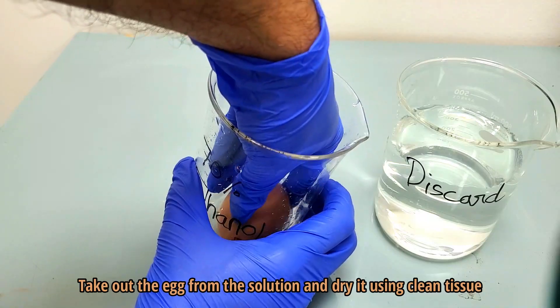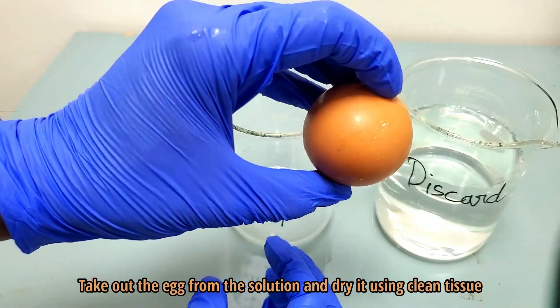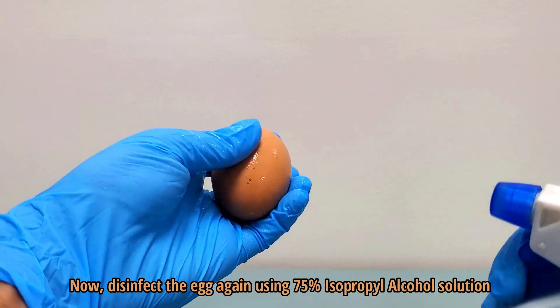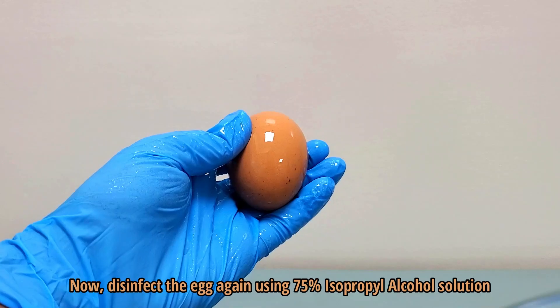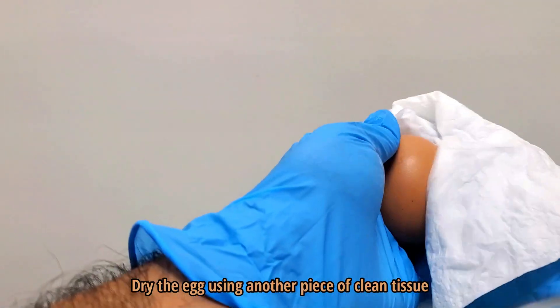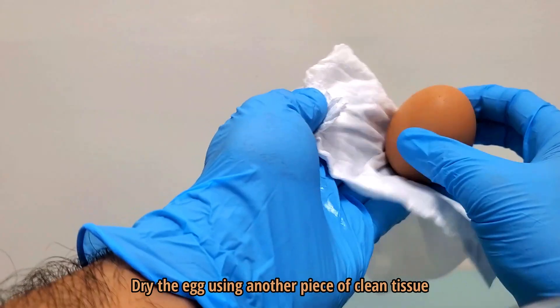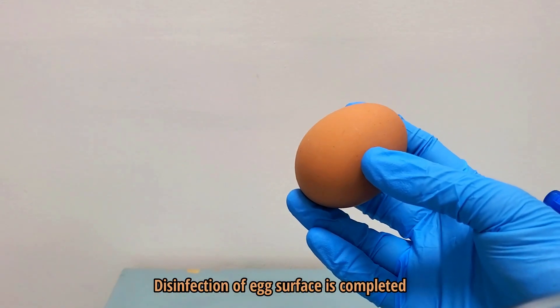Take out the egg from the solution and dry it using clean tissue. Now disinfect the egg again using 75% isopropyl alcohol solution. Dry the egg using another piece of clean tissue. Disinfection of the egg surface is now completed.